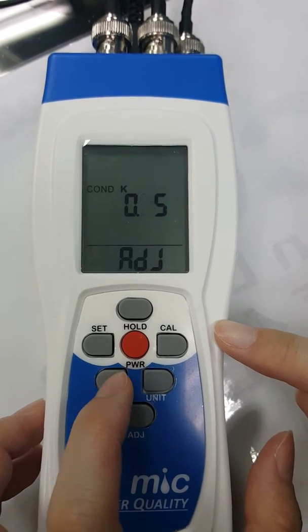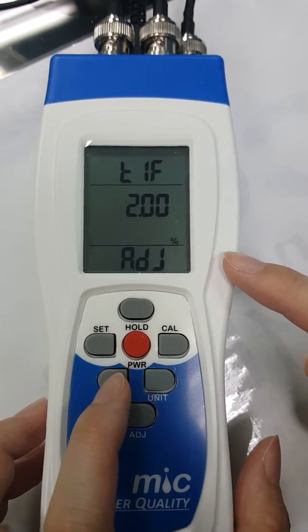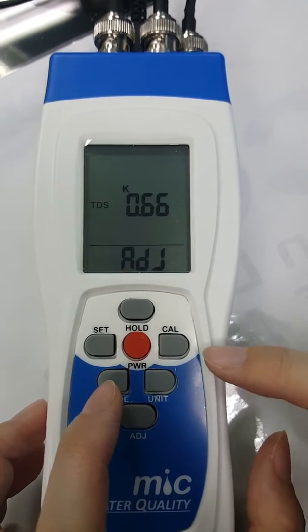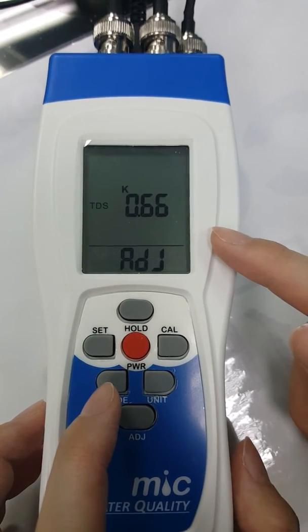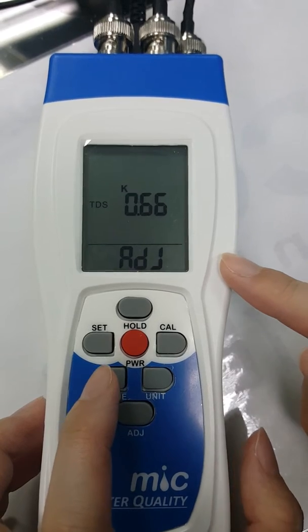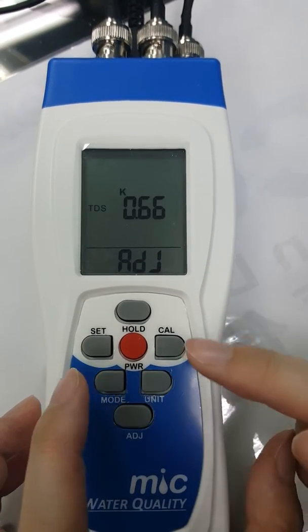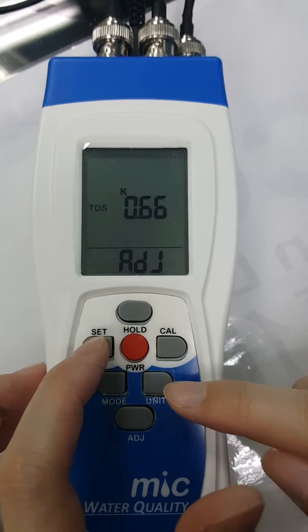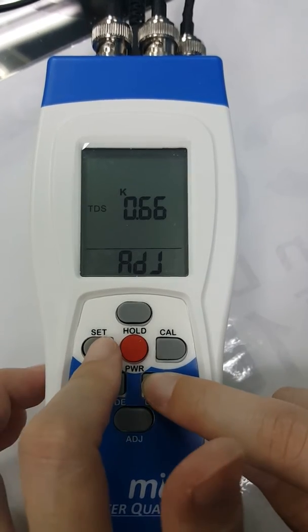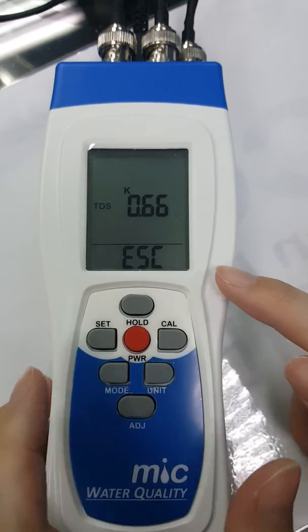Short press the mode button to enter temperature coefficient, and short press the mode button again to enter TDS value adjustment. If you don't want to change the reading, you can press the set button and the unit button again to escape the mode.